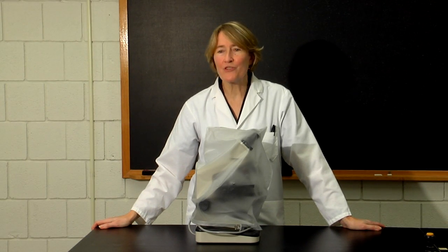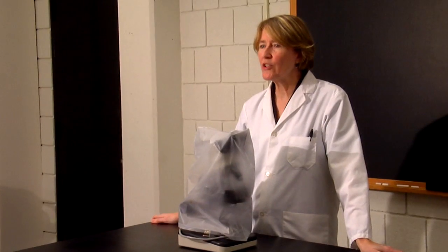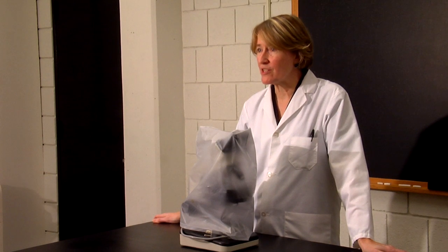Today I'm going to show you how to use a compound microscope. In the lab, the microscopes are located either in the cabinets within the lab benches or in the cabinets at the back of the room.